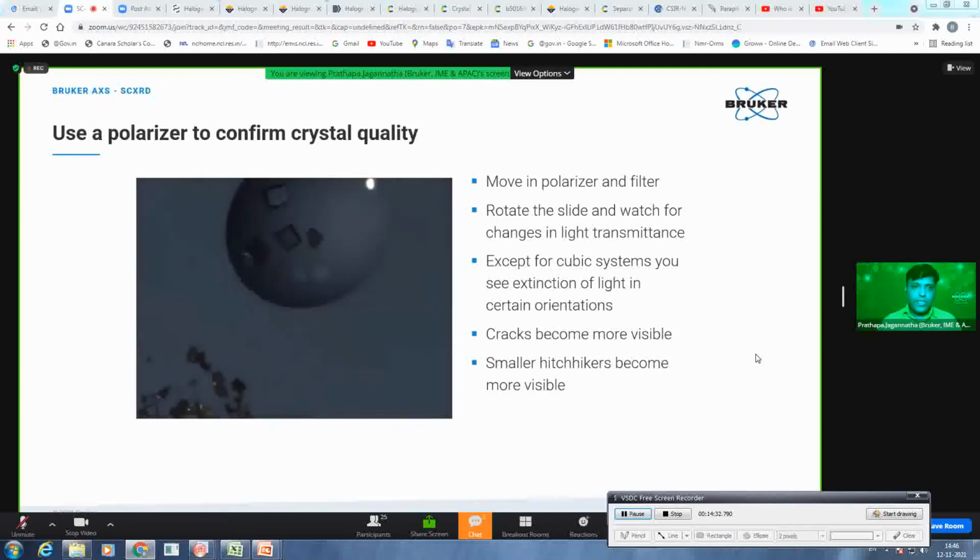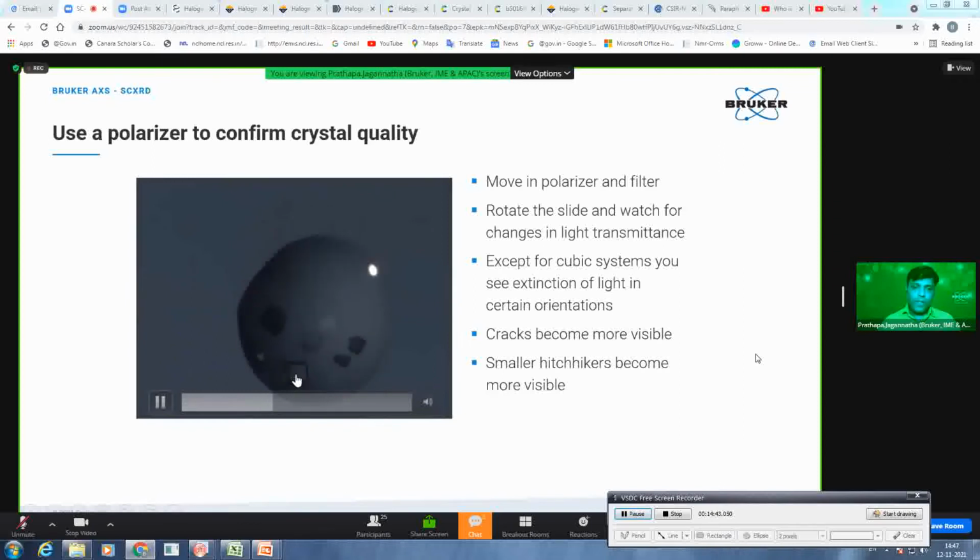And if there are any cracks or anything, he just wants to make sure that he is not choosing those kinds of crystals. So look here, these 3 crystals, which are darker now, once he rotates the polarizer, now it is becoming bright. So that means light is passing through. And then the other crystals are getting darker. Like for example, this, now it is getting brighter if you rotate in the other direction.